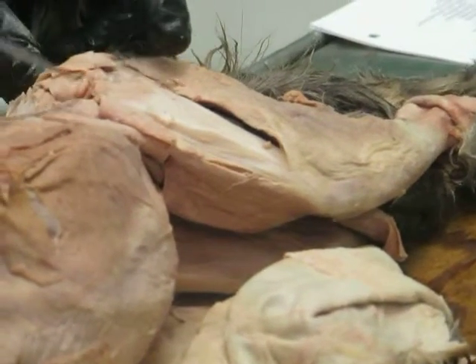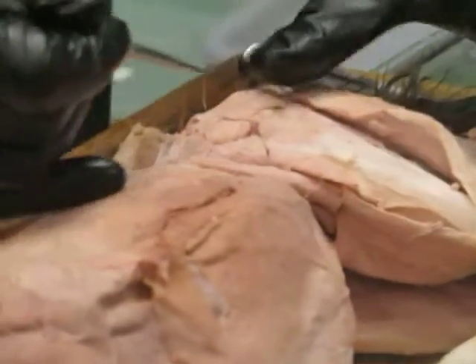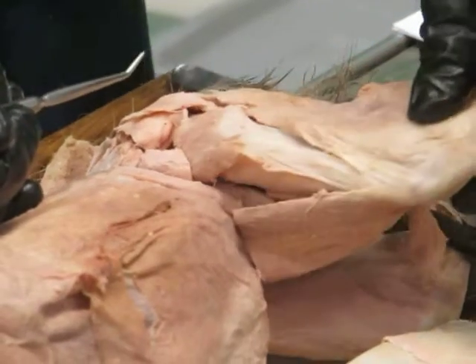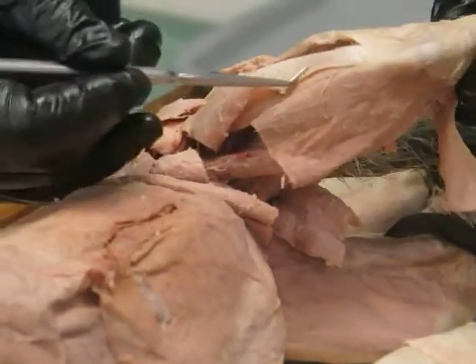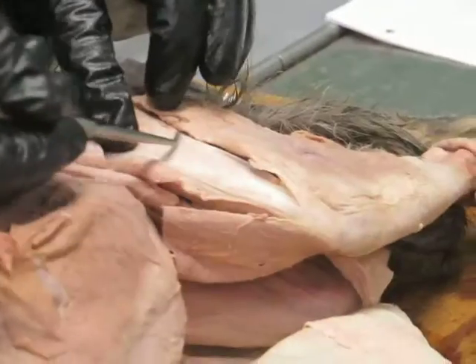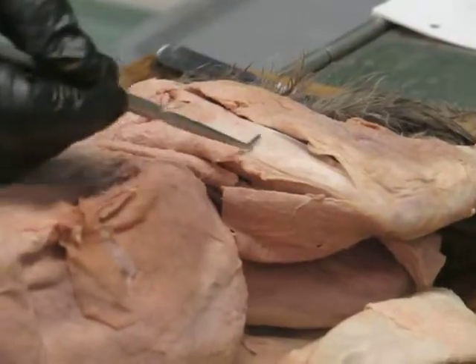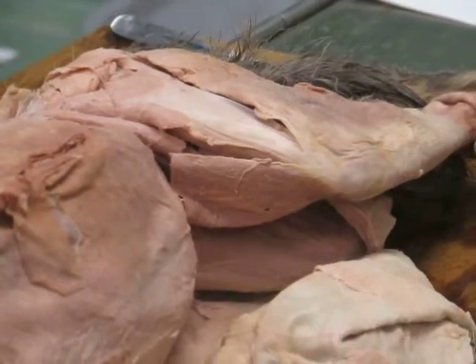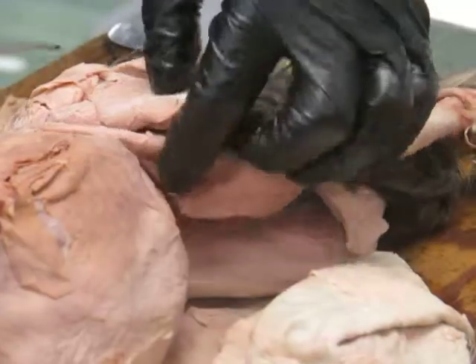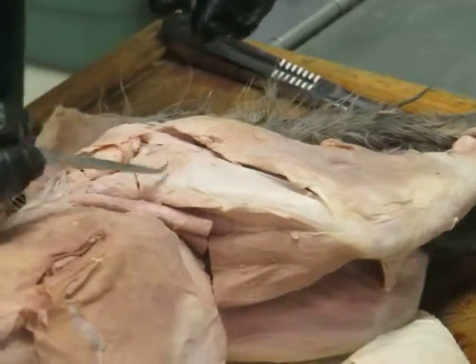And the tensor fascia lata is this muscle that inserts into the fascia latae and basically acts as primarily an abductor at the hip, also protractor, okay, since it's coming in front of the hip joint. And this fascia runs all the way down over here. And I mentioned, this is the IT band in us, and often gets very strained when people are running or something. They get these kind of tears in the fascia lata, which is a strain. Okay. The muscle itself is a little bit V-shaped, where it inserts into there, and that's a little confusing.